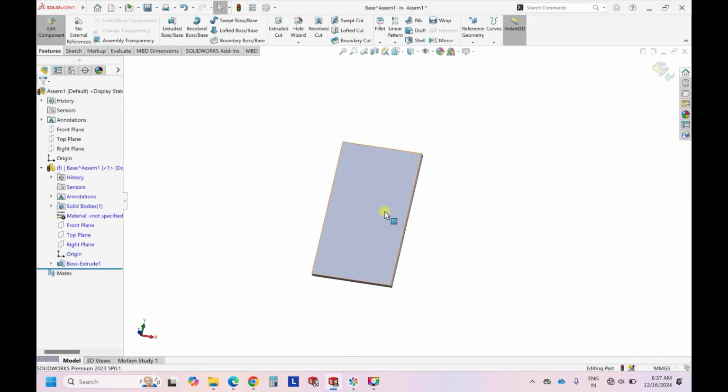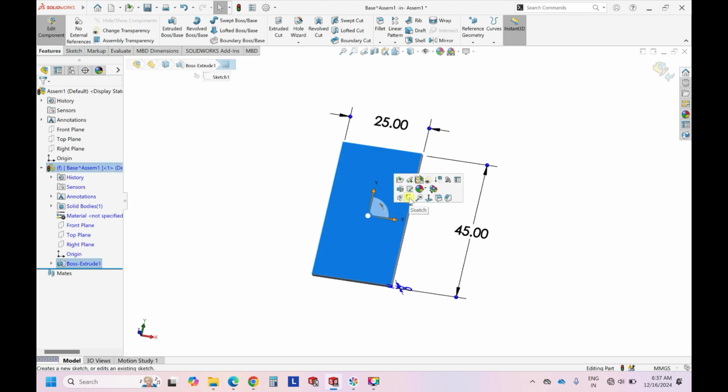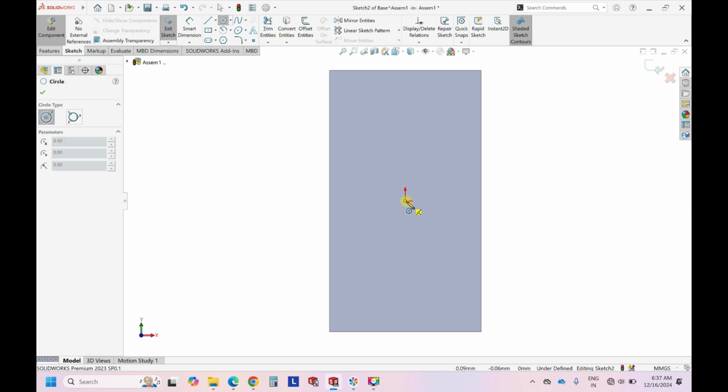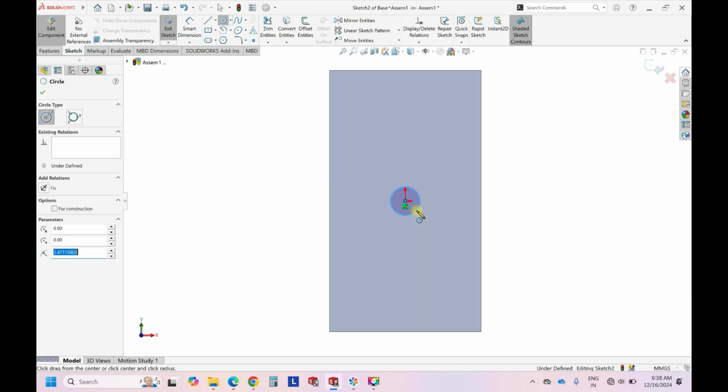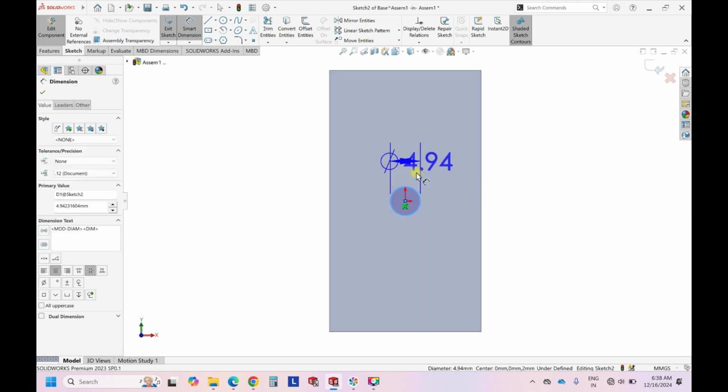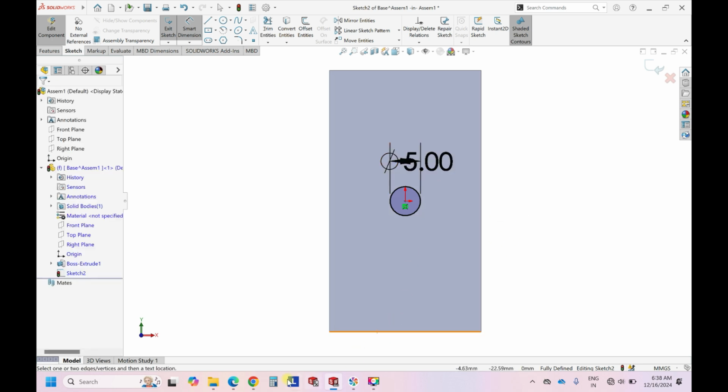Okay, again click on this face, just sketch on this face. So if you see, there is a circle initially, so let's give the dimensions of the circle as 5 mm. It looks pretty big, 5 mm.